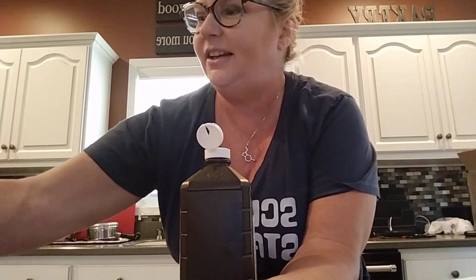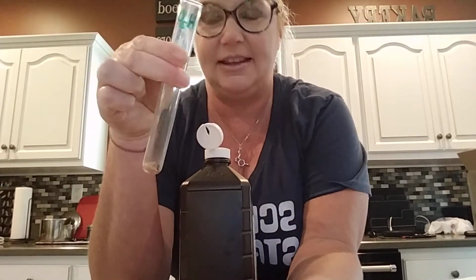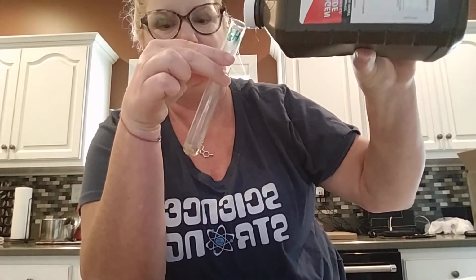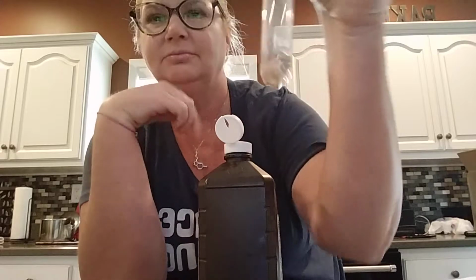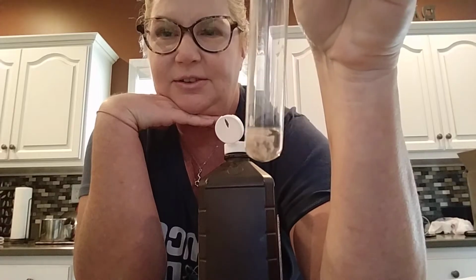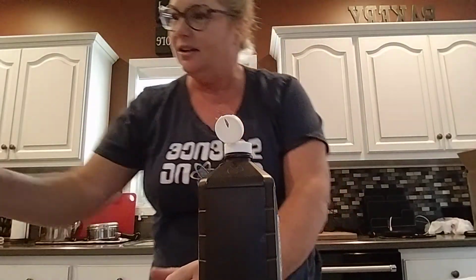Next we have the liver that was sitting in the hot water bath. So you want to take a look? 0 through 5, what's the foaming intensity? I'm following these in the order of the lab.